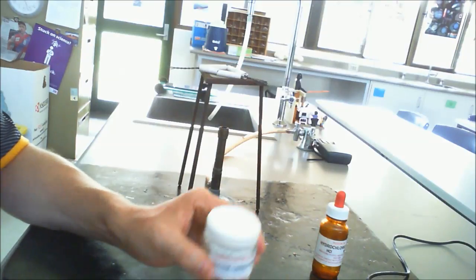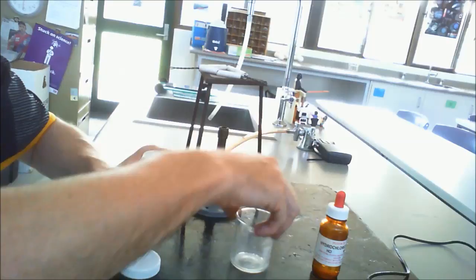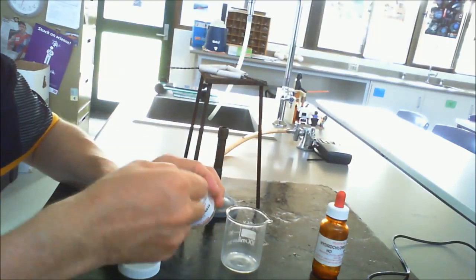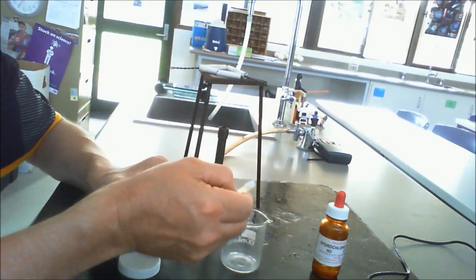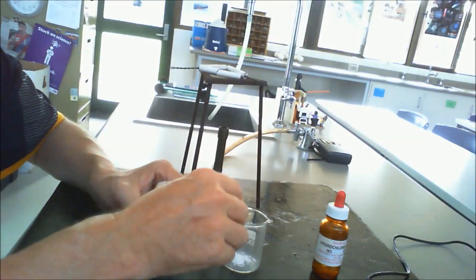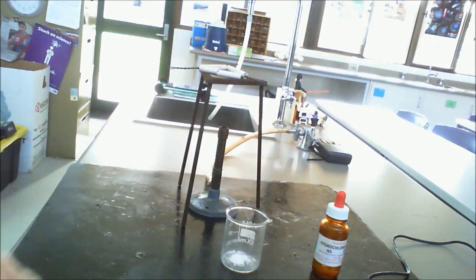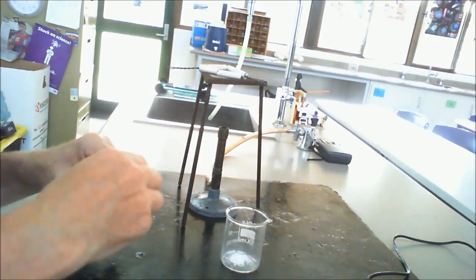Today, however, we're going to be using it in the powdered form, which is the calcium carbonate. So what I'm going to do with this particular beaker here is I'm going to place some calcium carbonate in, so you can see there just a white powder. So this is in your write-up, just a small amount of white powder there. Again, making sure that you always put the lid on, putting it out of the way, and then I'm going to add some of our good friend hydrochloric acid to it.